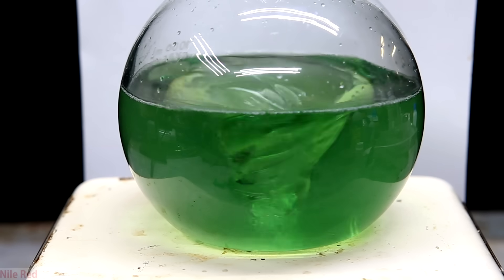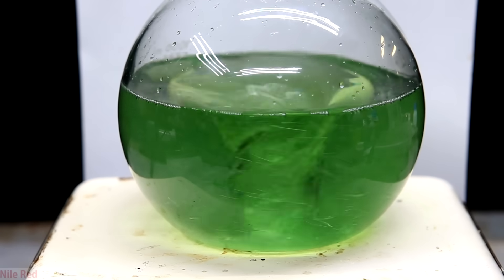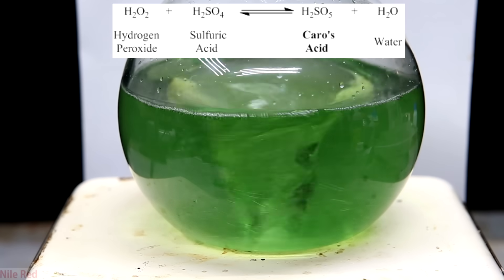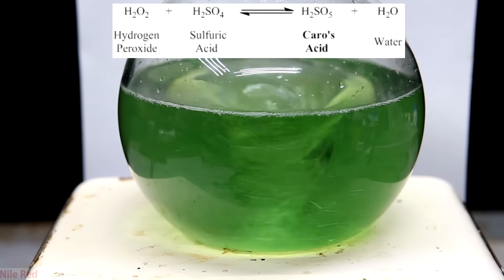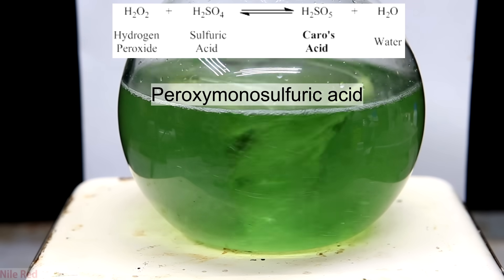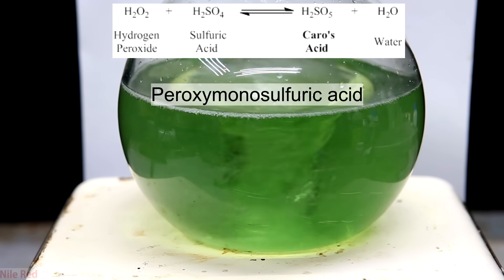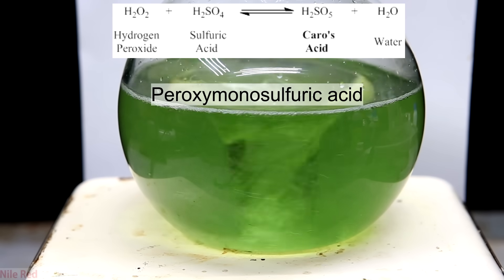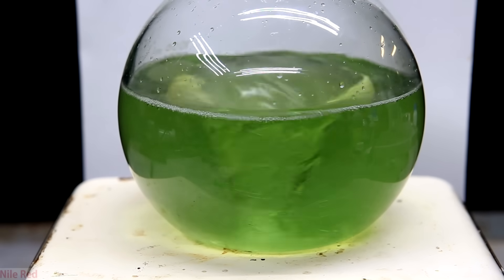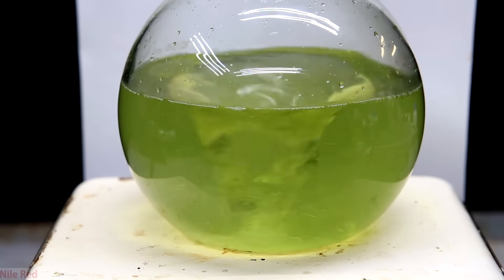What's happening here is when we add the peroxide to the sulfuric acid, we're making a dilute piranha solution. The equation shows sulfuric acid reacting with the peroxide to make something called Caro's acid — the chemical name is peroxymonosulfuric acid. Caro's acid is actually one of the strongest oxidizing compounds known, and a solution of it is commonly used in the lab to clean things — this is what's known as piranha solution.